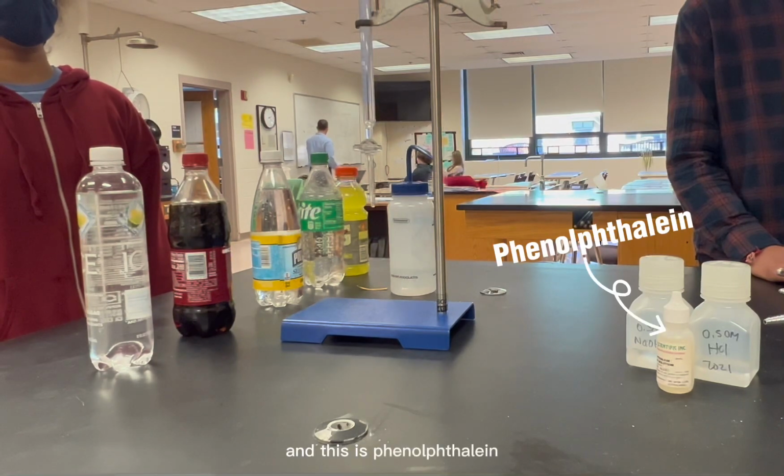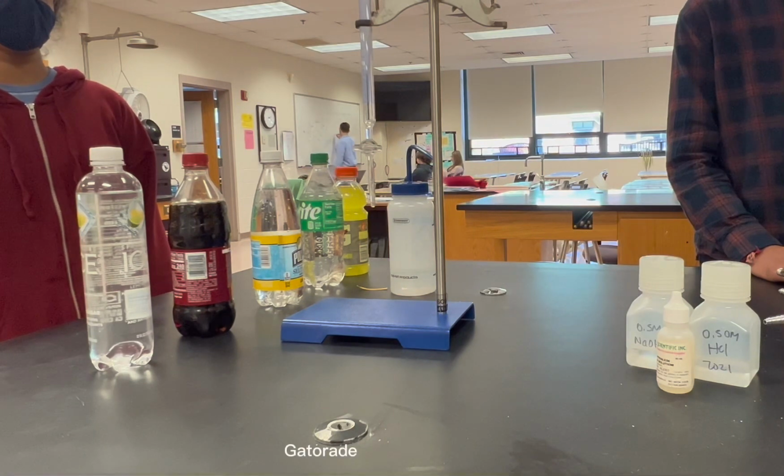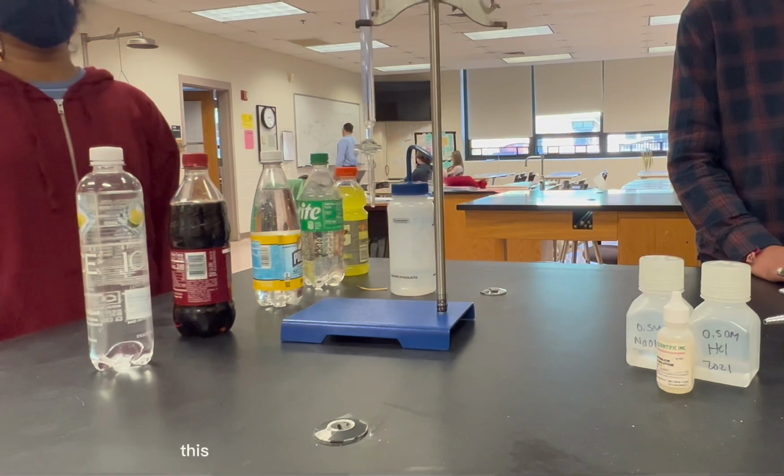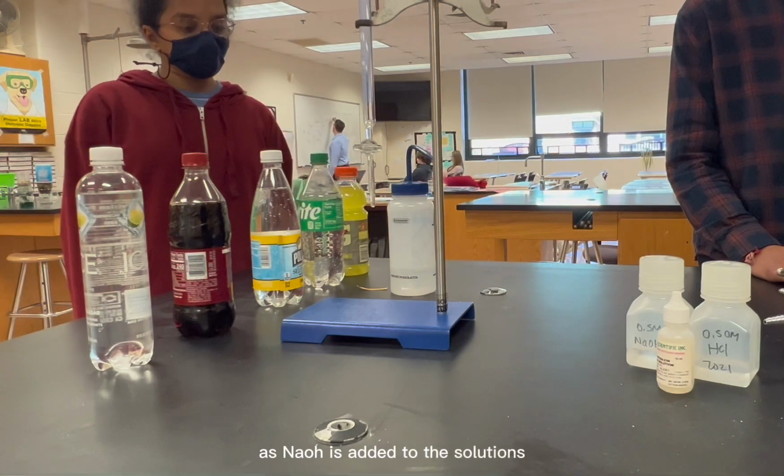And this is phenolphthalein. This is a colorless solution that's going to be added to Polar, Sprite, Gatorade, and Sparkling Ice. This solution is going to help us see the change in color as NaOH is added to the solutions.